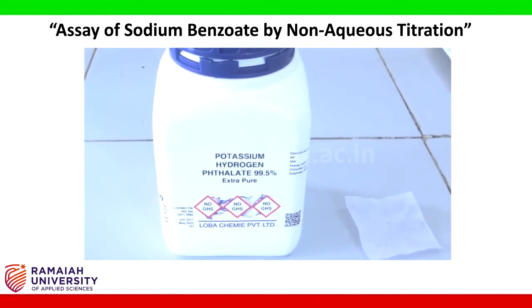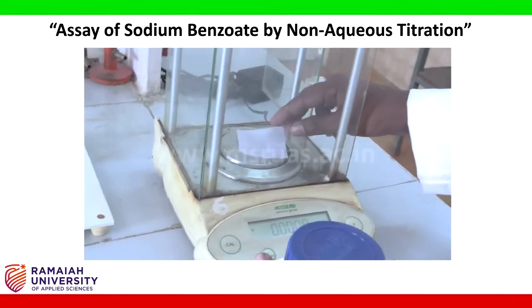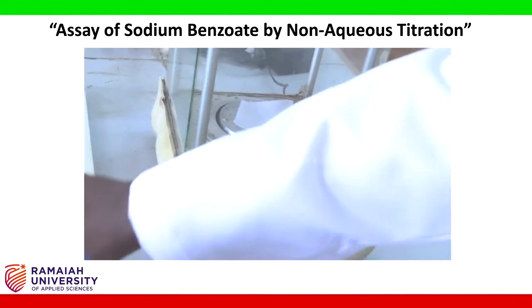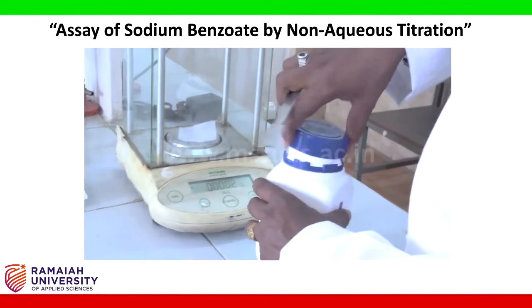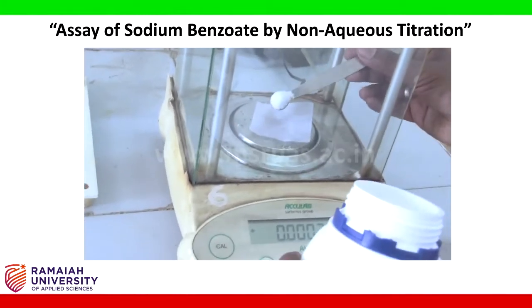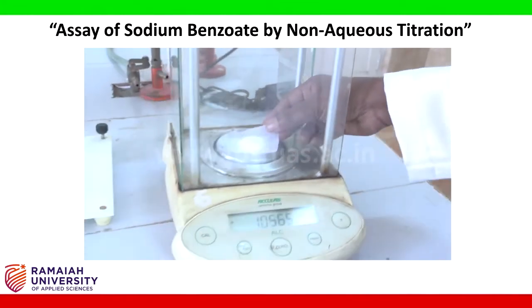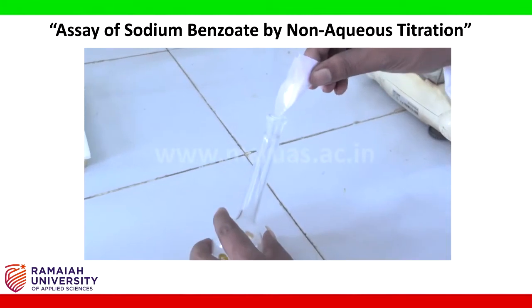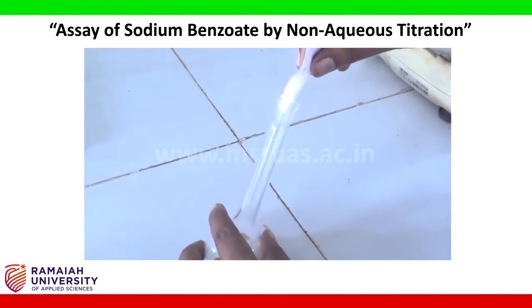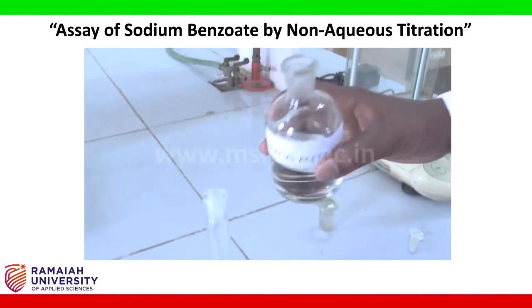Now weigh 1 gram of potassium hydrogen phthalate using butter paper. After weighing, transfer it into the 50 ml standard flask. After transferring, add glacial acetic acid up to the mark.